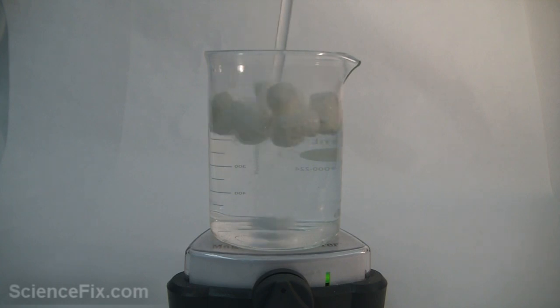The fastest way to do that is to make sure the water is warm because when a liquid has a higher temperature, the solubility becomes greater. I am using a stir rod because the magnetic stir bar is not sufficient by itself.